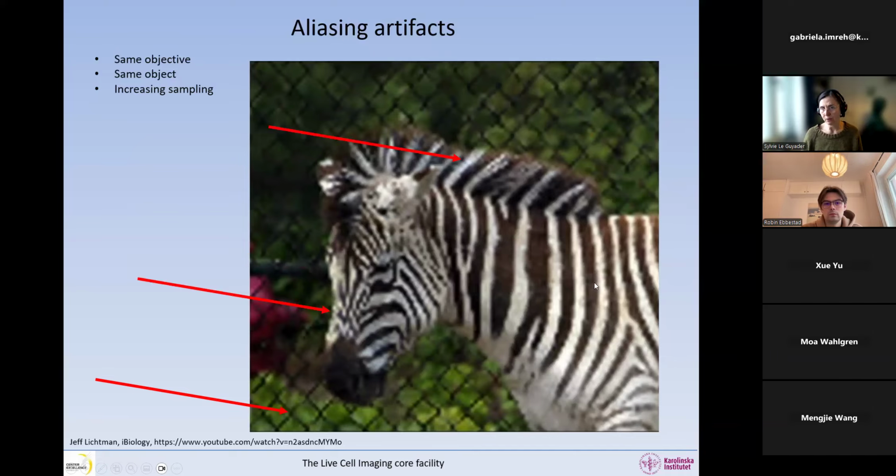If we now sample a little bit better, we can see that there are no bridges between the black lines. We have lost this checkered pattern that we have here, but the poor guy got a hairdo, a frizzy hair, which zebras do not have. Okay, so this is again an artifact. And we can see in here also that we have all sorts of strange patterns. And now we see the fence behind a little bit better, but we shouldn't have these little balls everywhere.